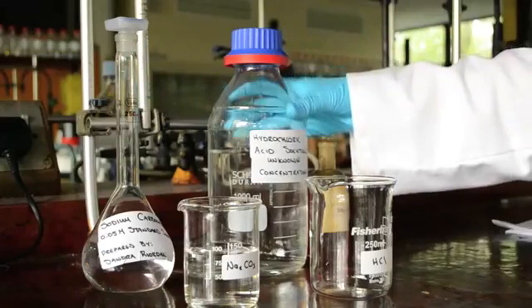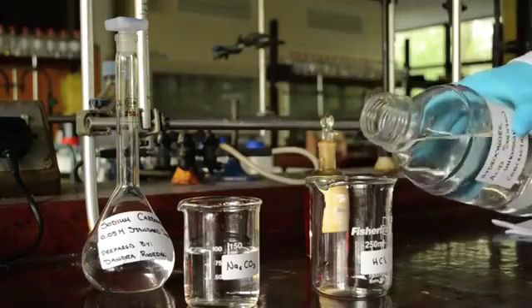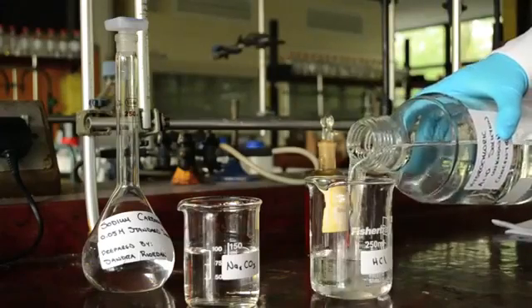I will do the same with the hydrochloric acid solution. Pour 100 ml roughly into this beaker.